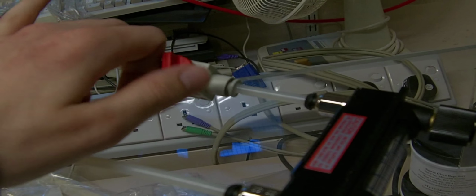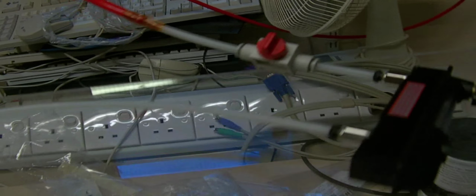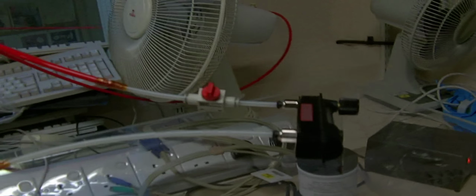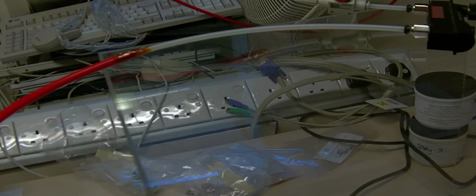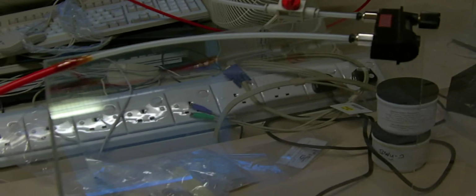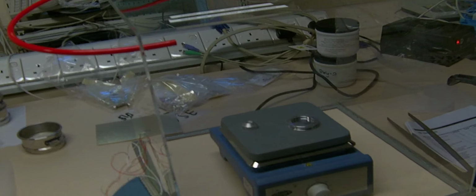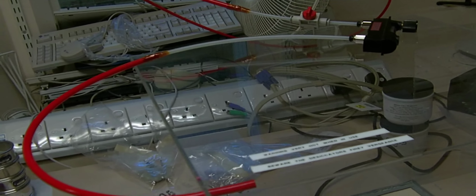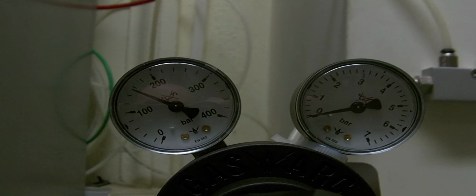So now what we're going to do for our first test run of the desiccator, I'm just setting up the data logger now, getting it running on the computer, because I want to check that when we let nitrogen go into the desiccator, we expect to see the humidity dropping over time. So we pump out the air inside of here and replace it with dry nitrogen. So I'm just going to go outside now and turn on the cylinder and see what happens. 1 nitrogen cylinder now running.